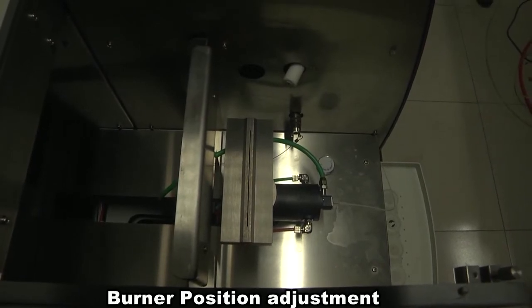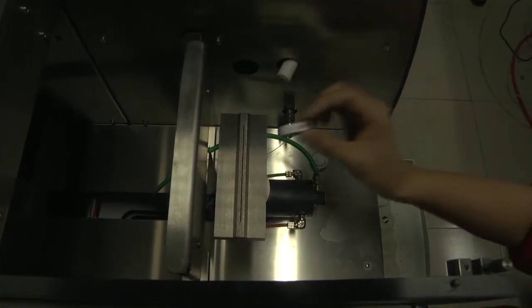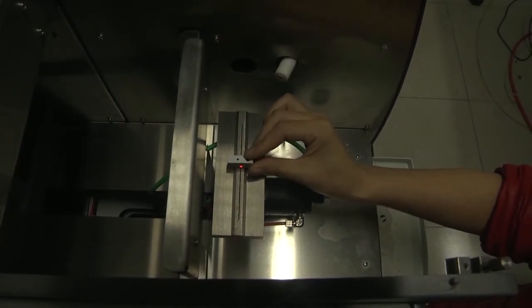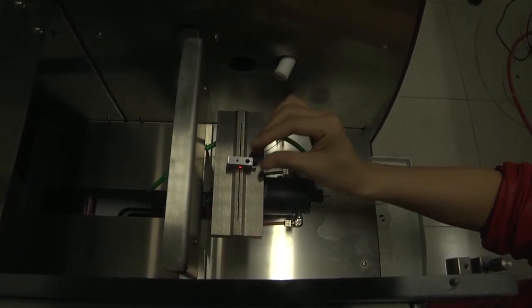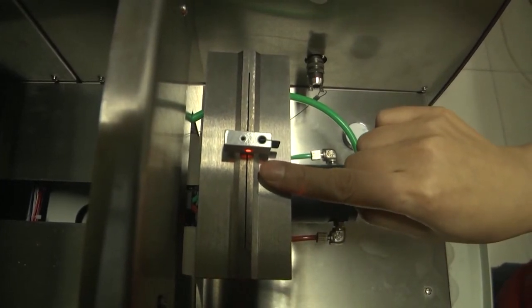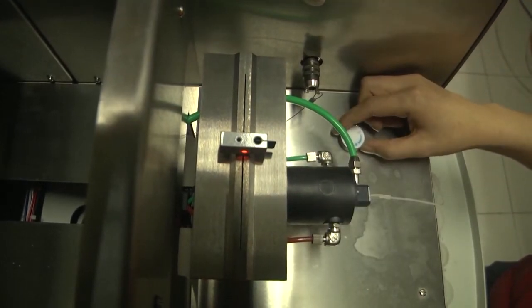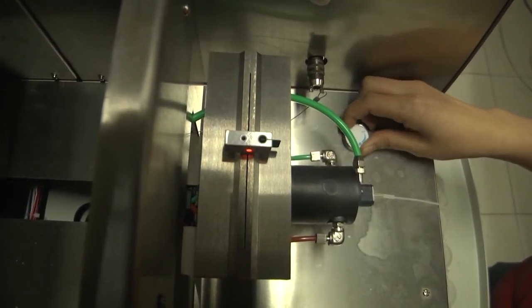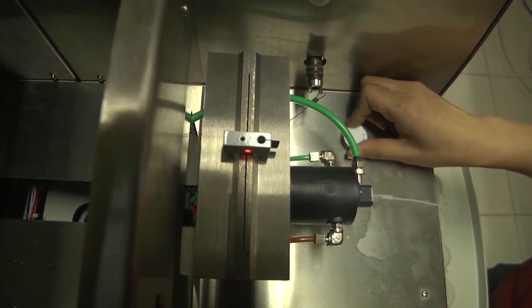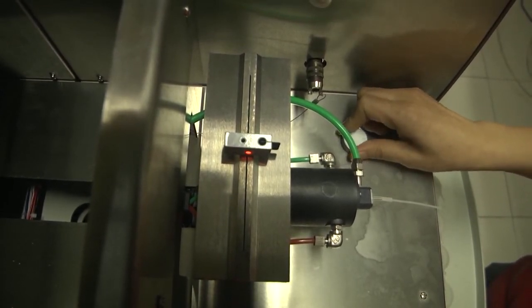Next step is to adjust the burner position. We need to take the path aiming block and place it on top of the burner. Observe the beam if it is right on top of the slot. If not, we need to rotate this knob to make it forward or backward of the burner.